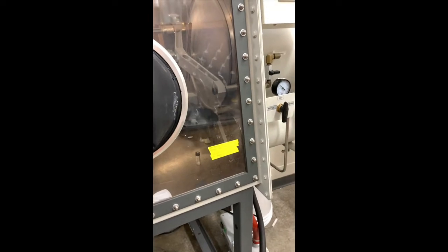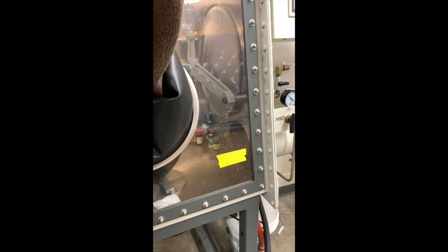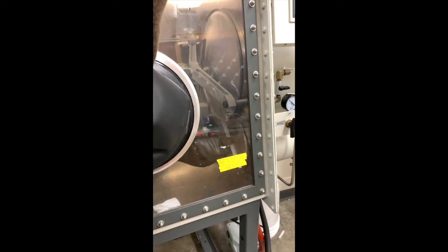And we can come here and see on the inside of the box. I can pull this handle towards me and that will release the door. And I will put my vial in here very gently. It's okay if it falls over. And we'll put this back on.